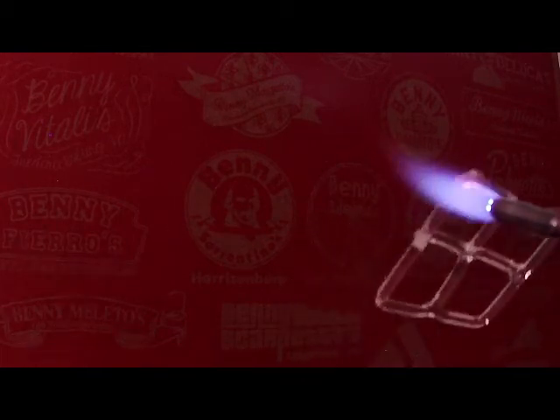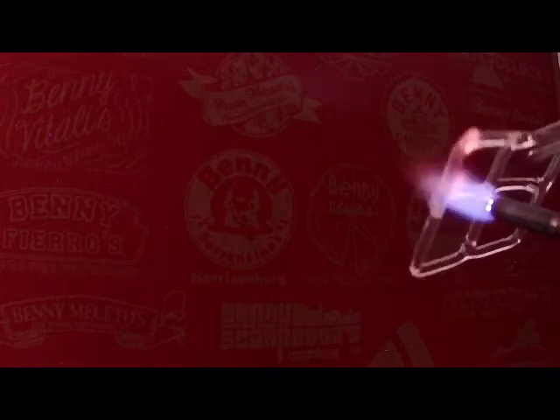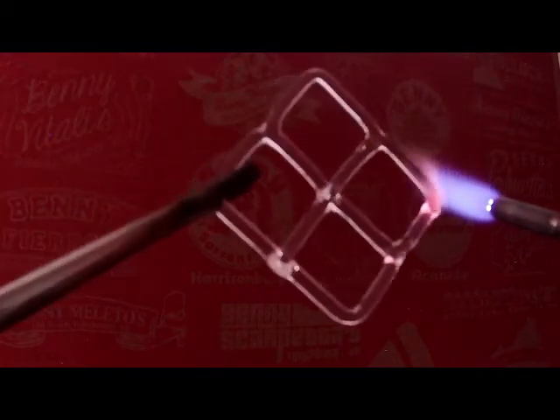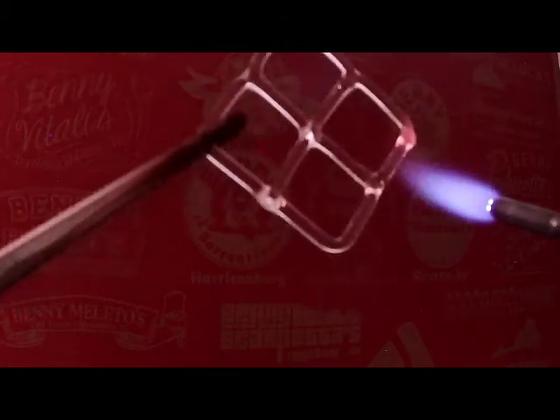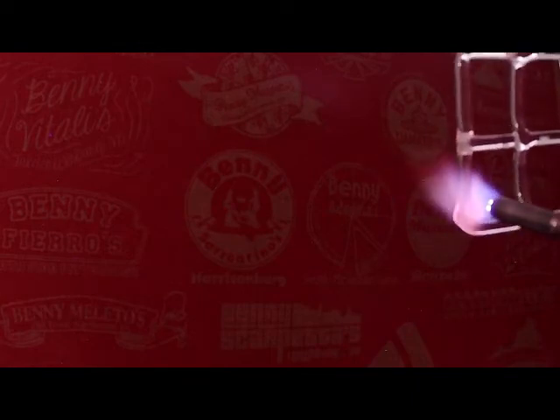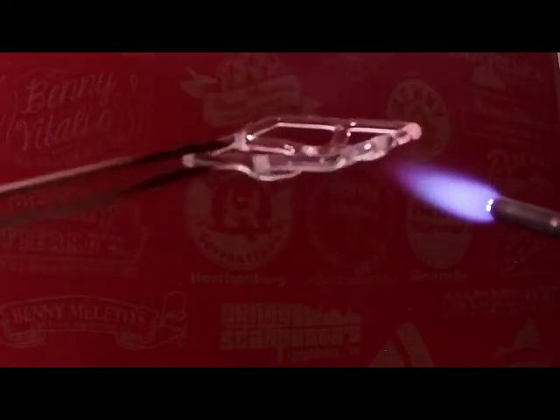I am holding the glass with the tweezers, which can be a problem as far as cracking. However, because of how thin this glass is, I don't think touching it with the metal tweezers while it's still hot is going to induce cracking. But that would be something else to think about. If I was really concerned about this piece, I could put a cold seal or even a hot seal on the opposite side with some 3mm glass rod, and then that would be okay. So right now this weld looks pretty good. It's got a little bit of a bump in it because of the excess glass when I pulled it off that I didn't remove, but that's more aesthetic than anything else at this point.